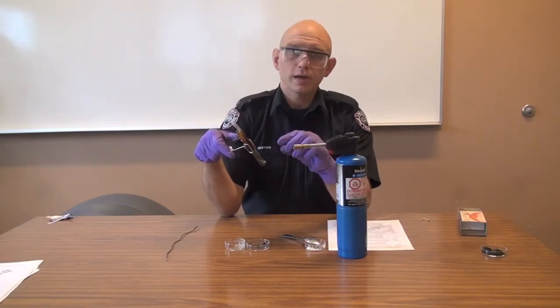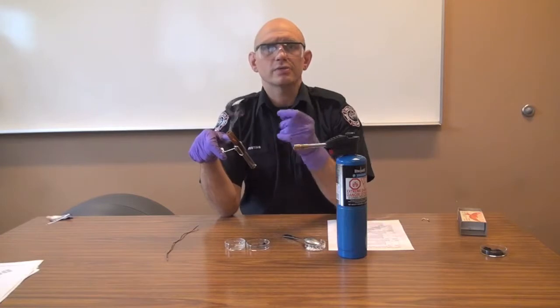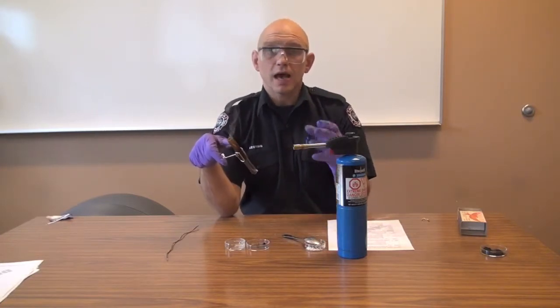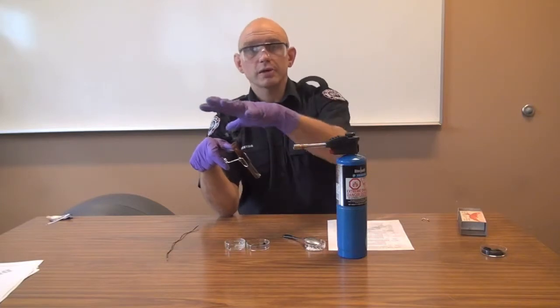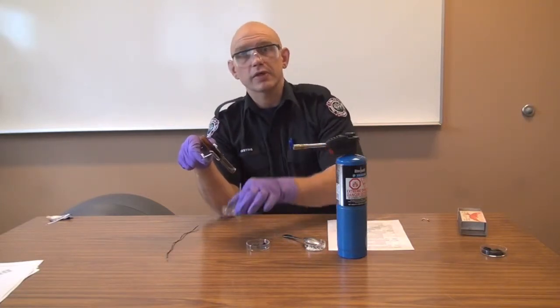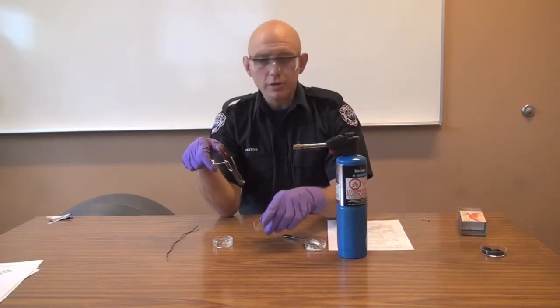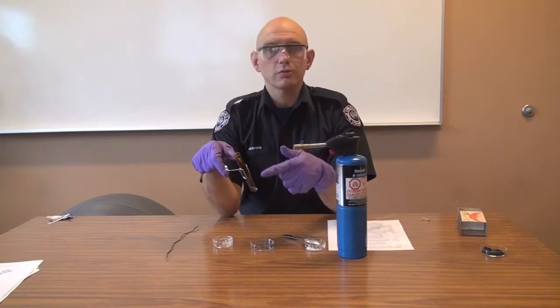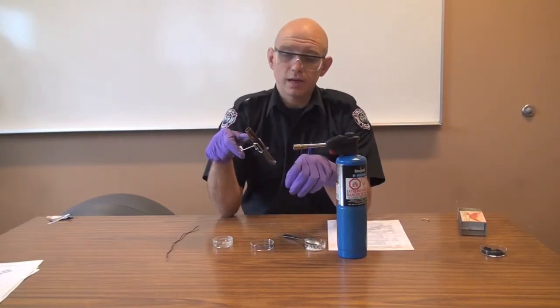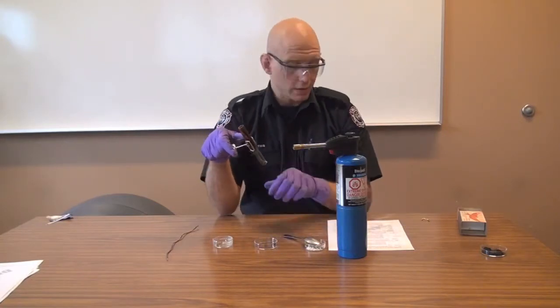The theory here: we've got the matchsticks in there. As we heat the matchsticks, they pyrolize — they release gases. This gas and smoke displaces the oxygen. At that point, there's no oxygen left, except possibly from the chemical you've added. If we did this with the other chemical here — that's charcoal — we'd get smoke coming out the top, but we wouldn't see that flame inside the test tube. Therefore, charcoal is not an oxidizer.